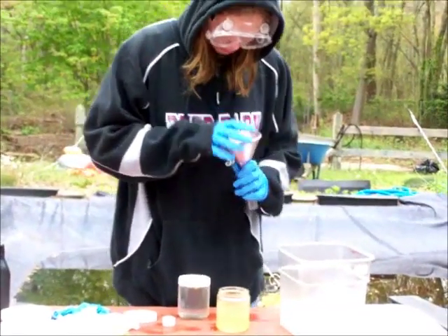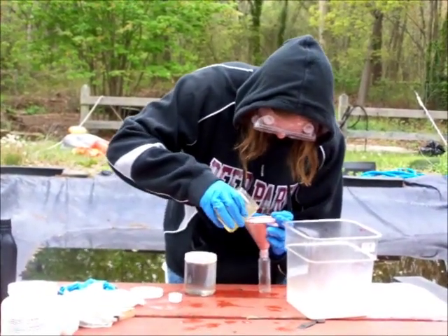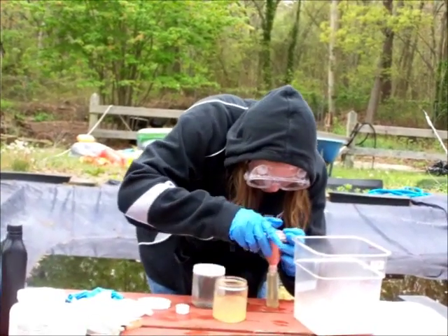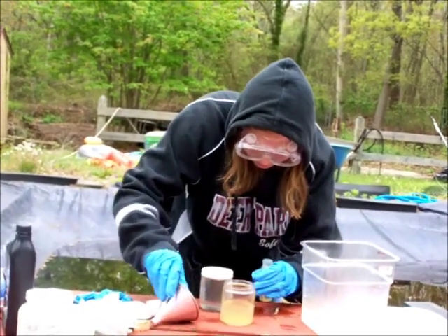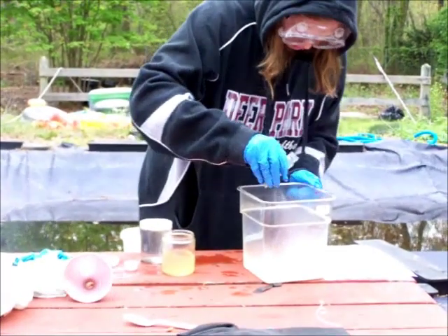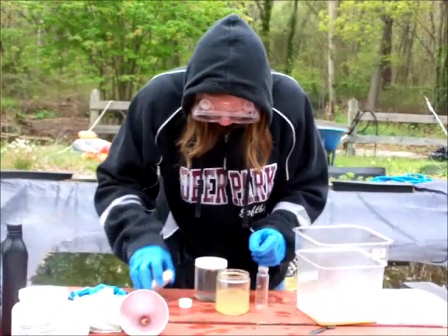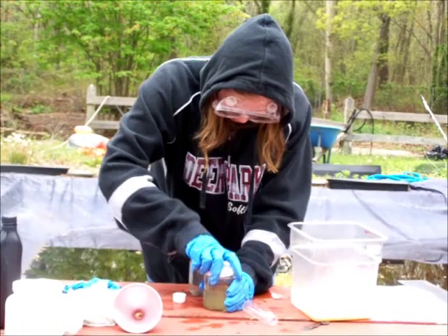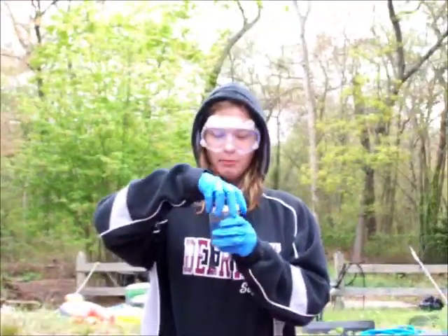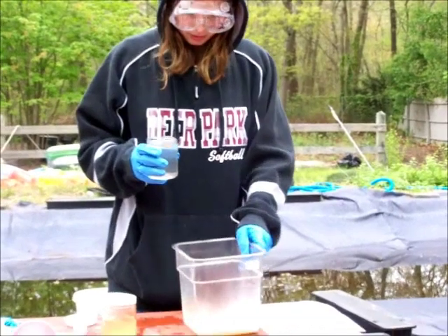What I'm going to do right now is pour out 50 milliliters of this into my glass vial and pour it over here in my container. Then I'm going to take my 35% lab grade hydrogen peroxide, H2O2, and add it in to the container.